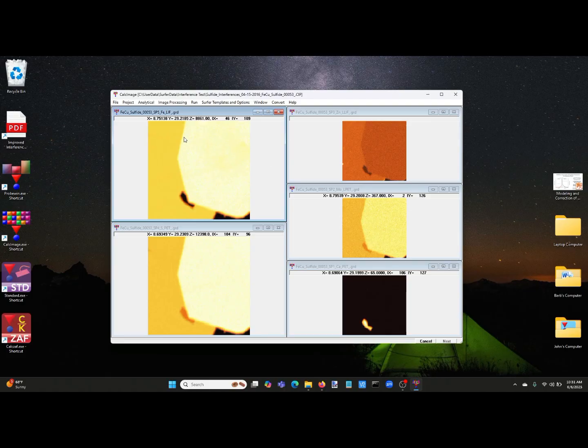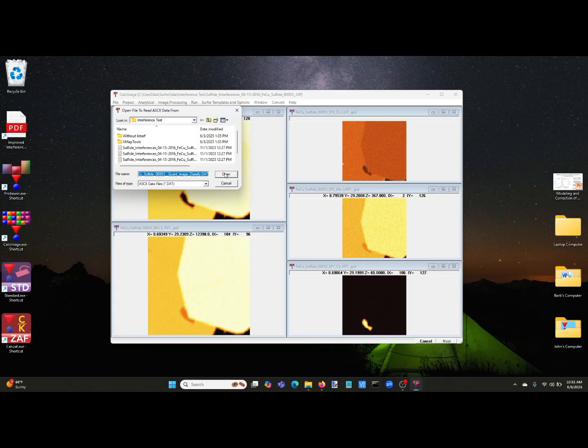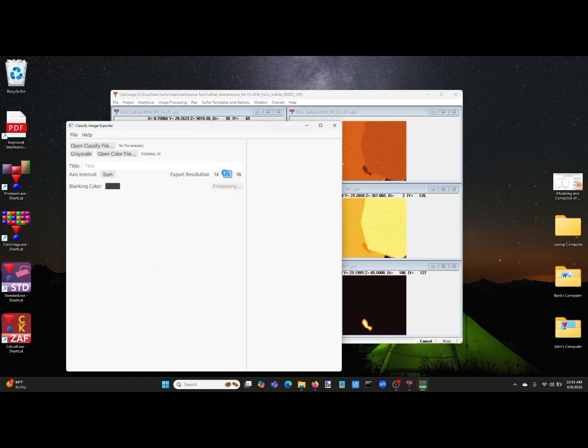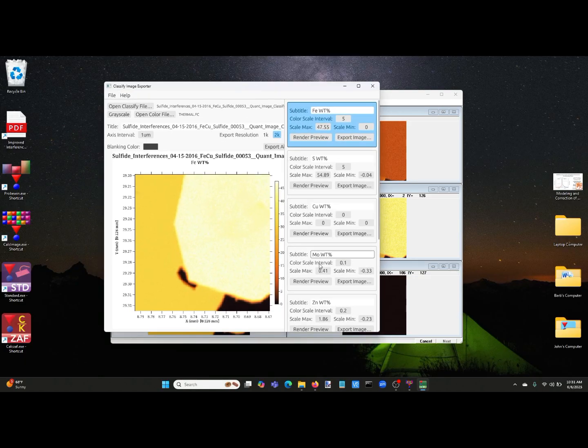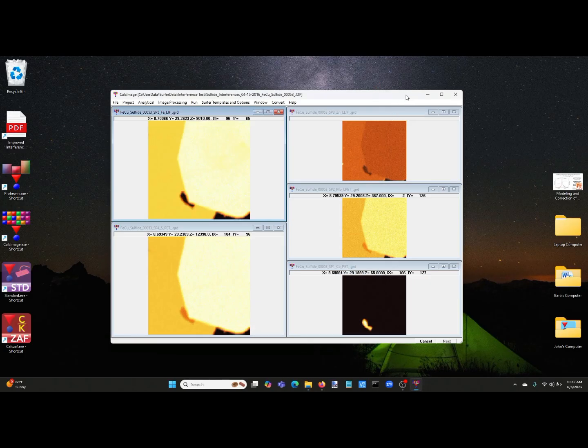And again, we have the interference correction turned on, and if we look at the map when we export it, we can see that our molybdenum map has no molybdenum in the iron sulfide or the copper iron sulfide. And in fact, the interference correction now reveals the actual phase that contains the molybdenum, which is a small amount of about 0.28% molybdenum. All right, that's how you correct for quantitative interferences.